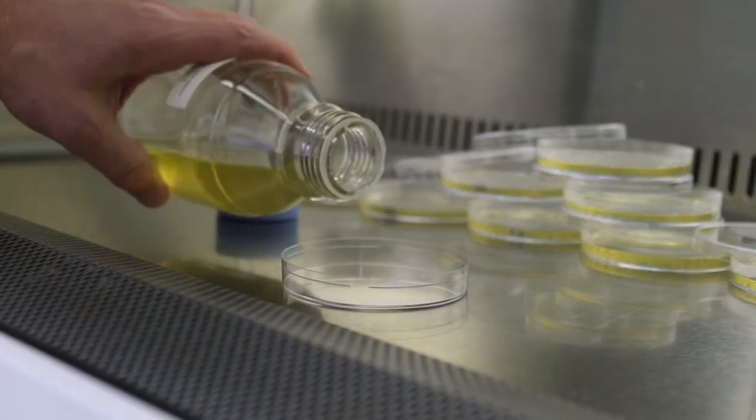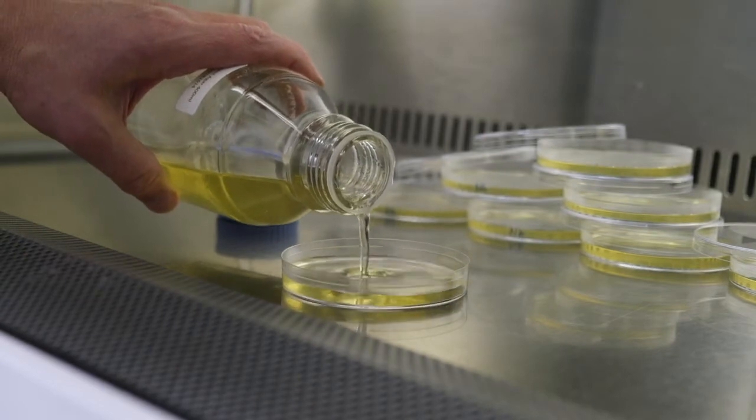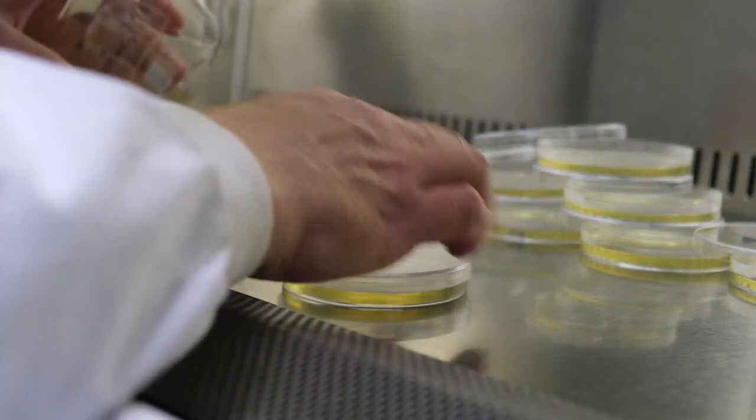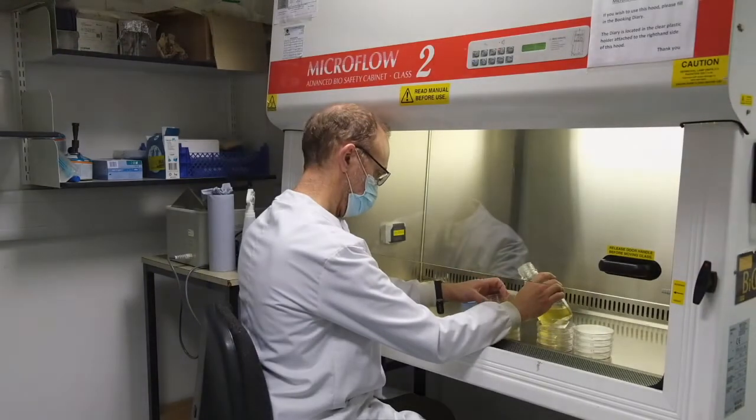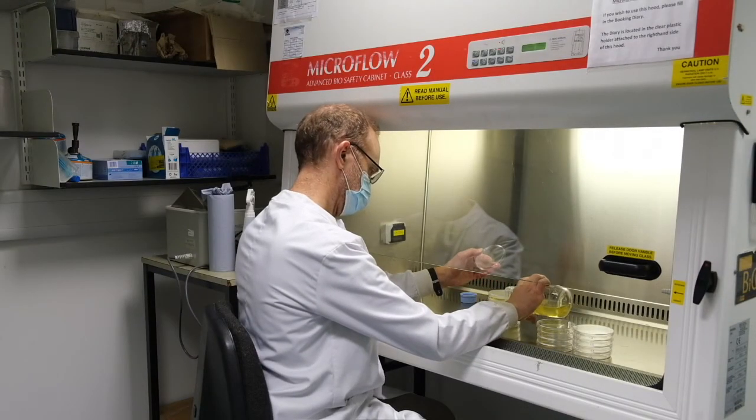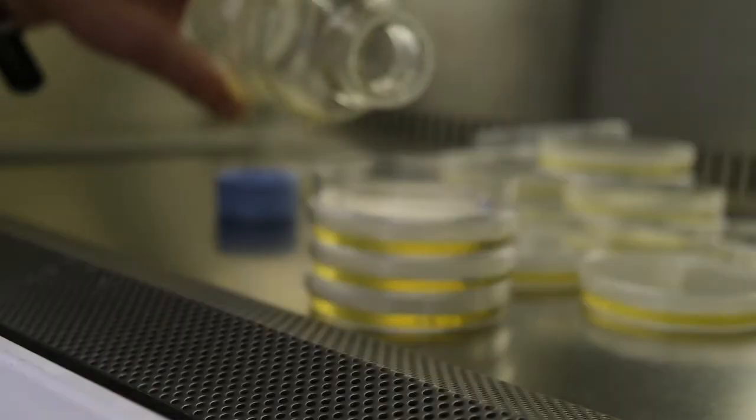You want the agar to cover the base of the plate and come up to a depth of about half a centimeter. Keep pouring your plates until you have used up the entire bottle of media.